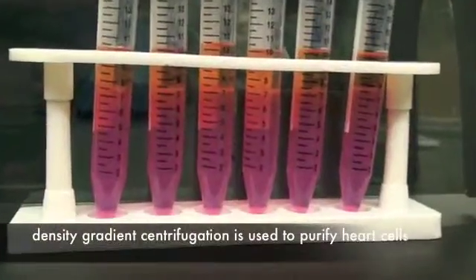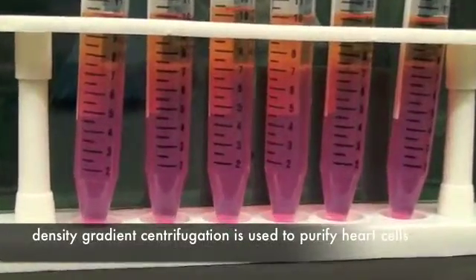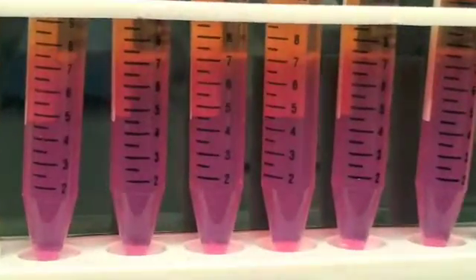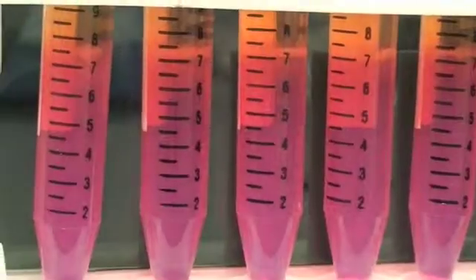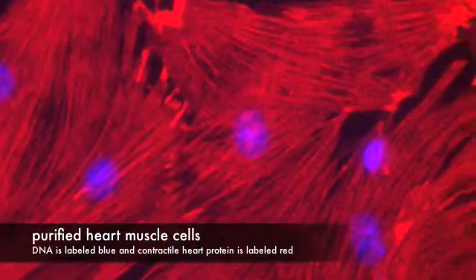We use density gradient centrifugation to purify the heart muscle cells from other non-heart cell types. The high density of cardiac myocytes relative to most other cell types makes this a fast and efficient process.